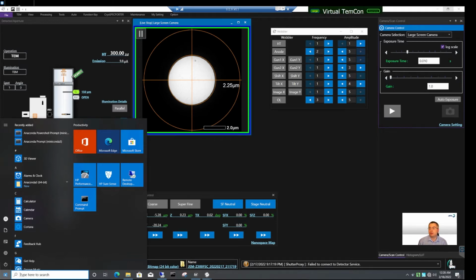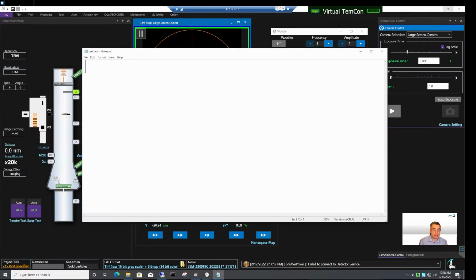On older microscopes, this may be used to create a parallel beam button, a button that you click on in order to very quickly set parallel beam conditions. How can we do it with PyJEM? Well, let's write a simple script.